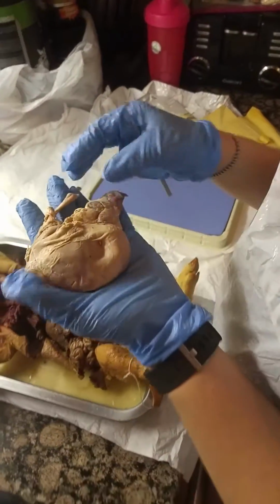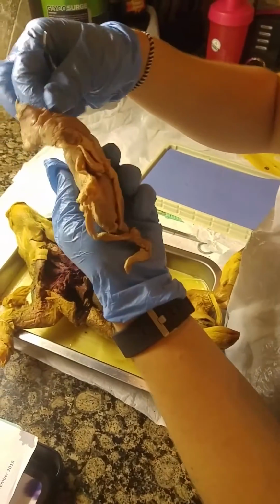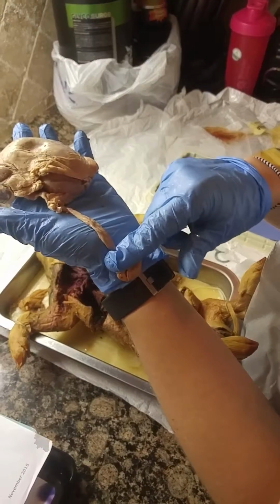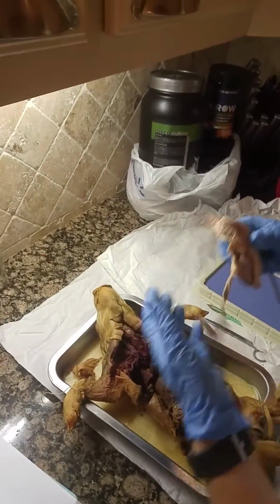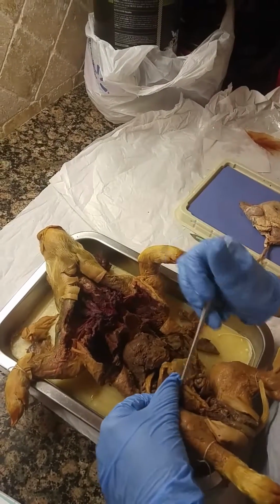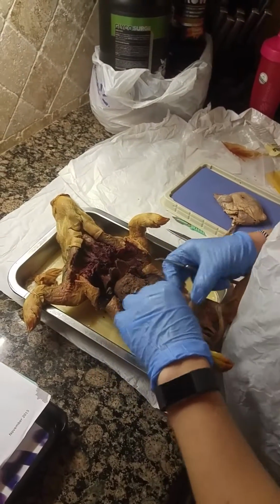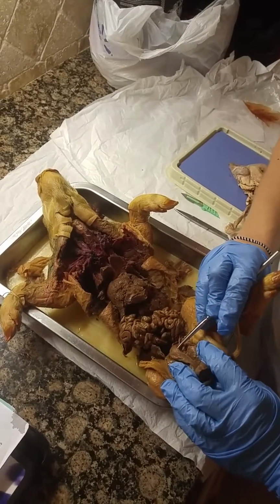On the outside of the sheep kidney, the adrenal gland sits superior, in a small sac at the top of the kidney. This is the ureter, where the kidney drains, and then the urethra on the fetal pig would be here at this small opening. It's this line running up and down here. And then the urinary bladder is this empty bag-looking sac right here.